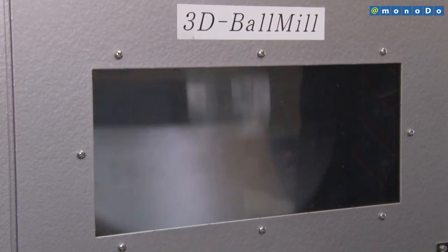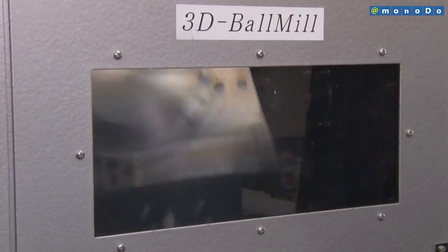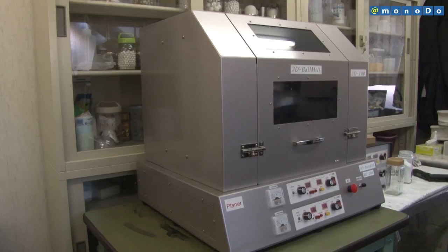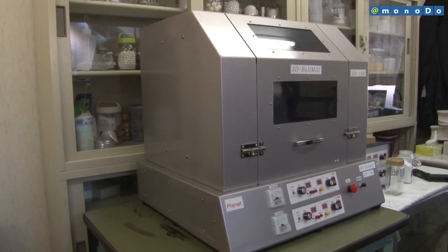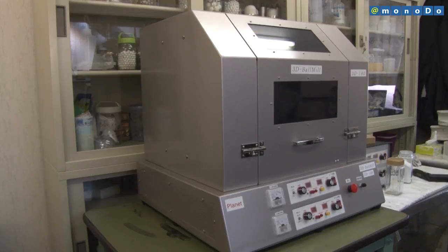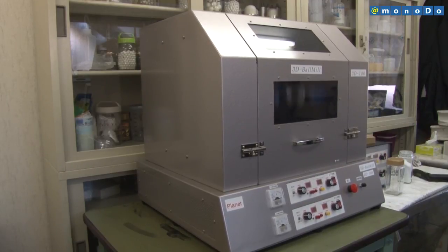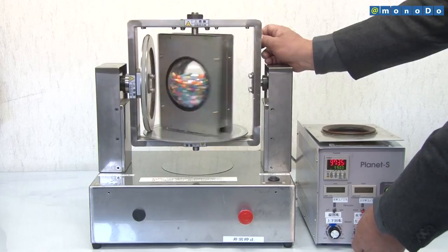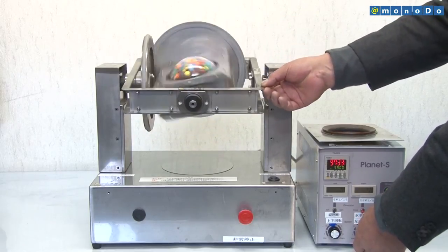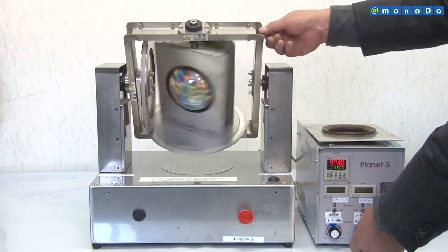A ball mill is a device used to create an even finer powder material by inserting the sample into a container together with hard balls made of material such as ceramic, and then rotating the contents to smash them together. A conventional ball mill has a tubular container and rotates in one direction.